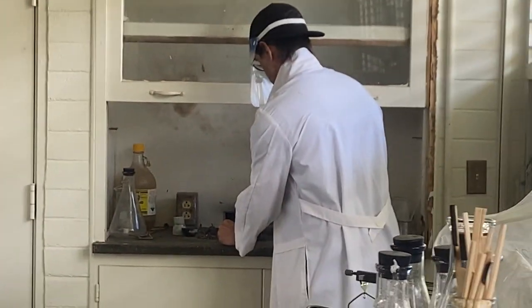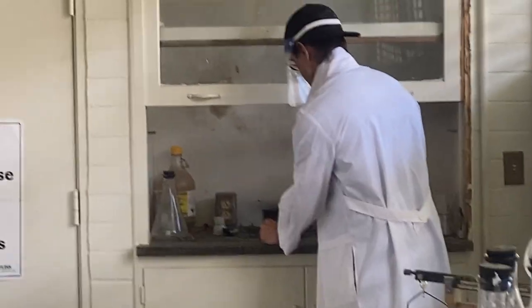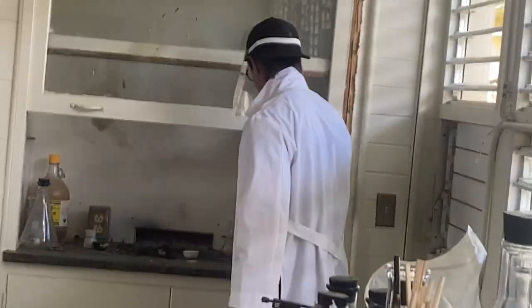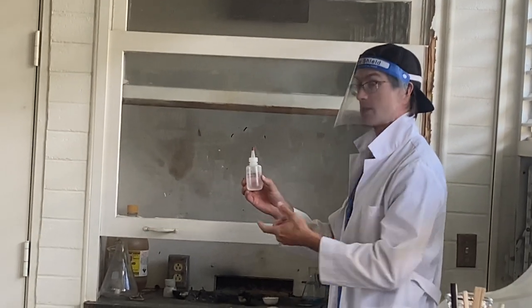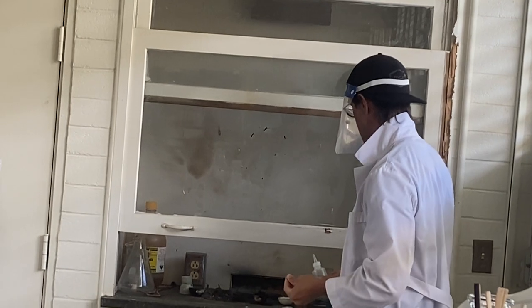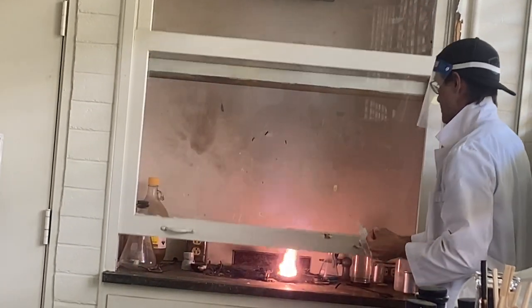My hands are so shaky. I don't know about you all, but I'm kind of impatient. I don't have time to wait around for this to just spontaneously react. So what I have here is a bottle of concentrated sulfuric acid in this dropper bottle, and I'm just gonna put a few drops on that and get it going.